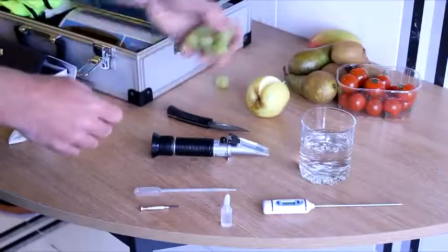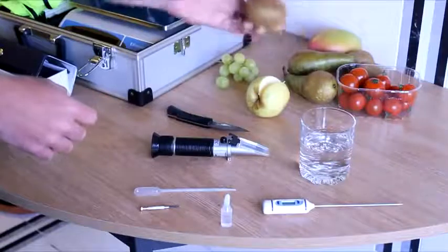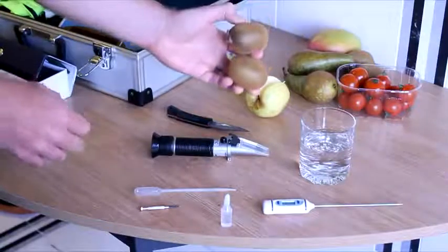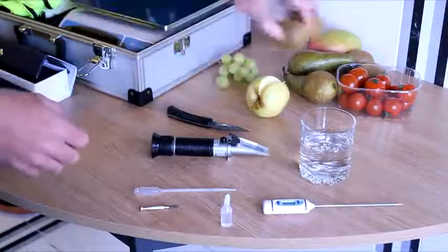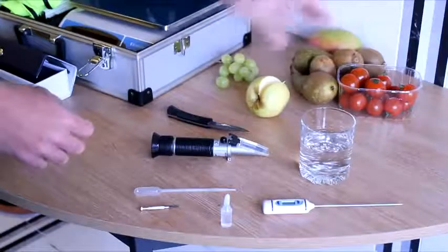In terms of selecting your sample, take multiple fruit, whether it be small or larger fruit, and always be careful to discard any products which may show defects likely to affect the readings.